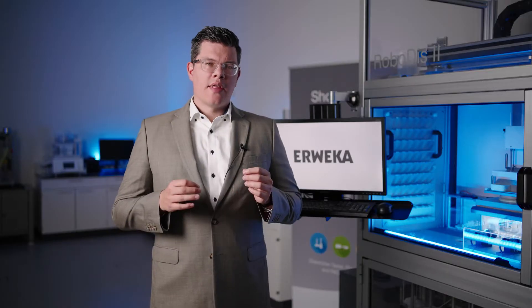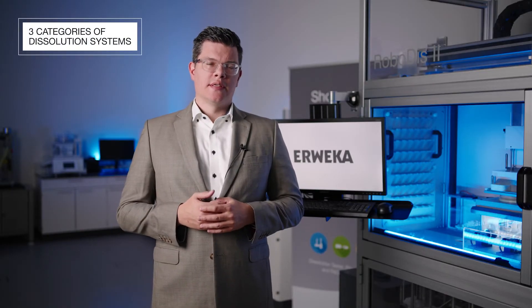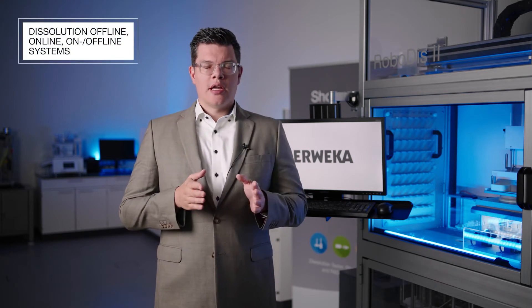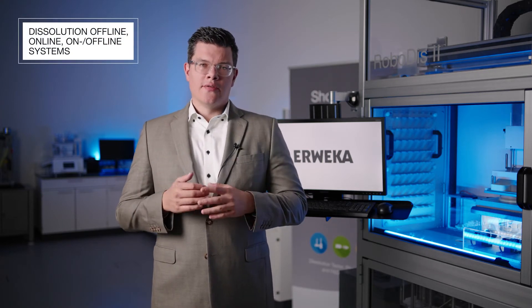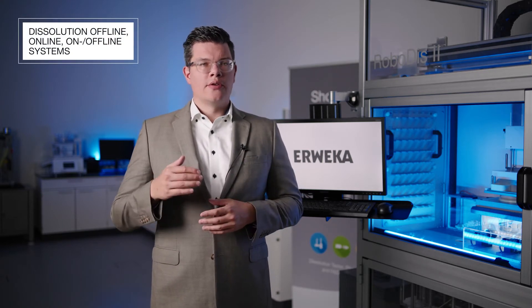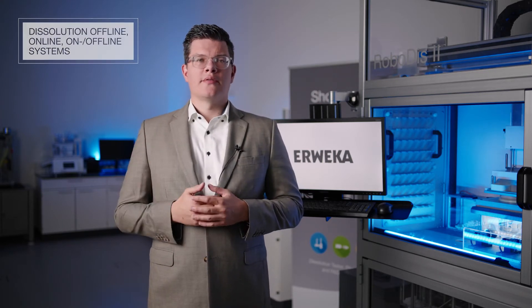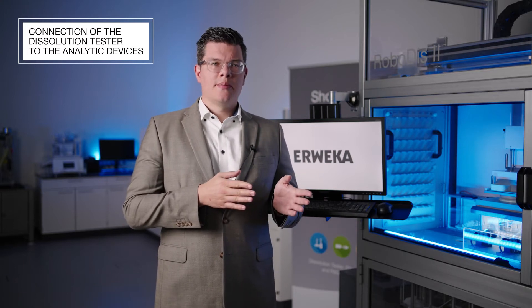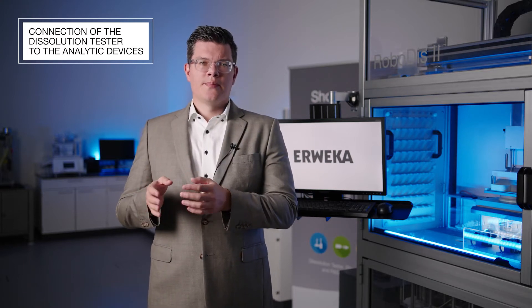There are three categories of dissolution systems: offline, online, and on-offline, with increasing automation level. These three terms have nothing to do with an internet connection, but they describe the connection of the dissolution tester and its test samples to the analytic devices.